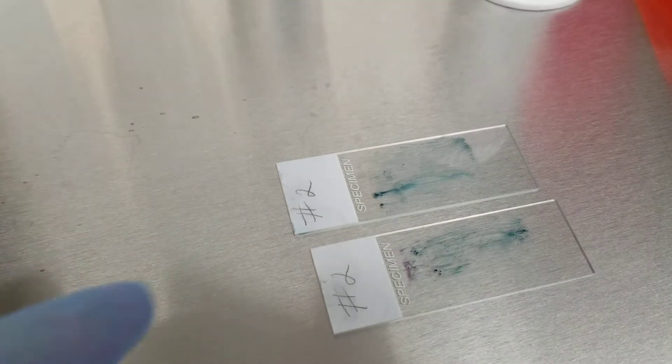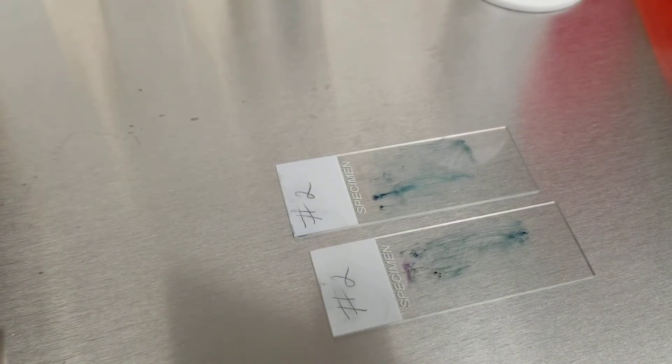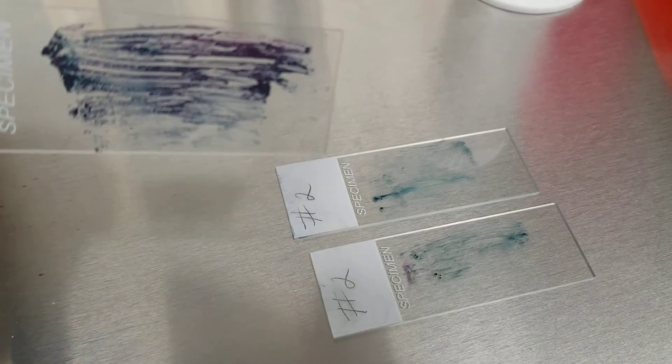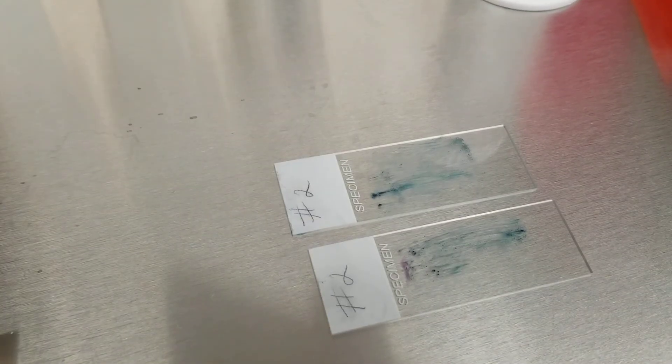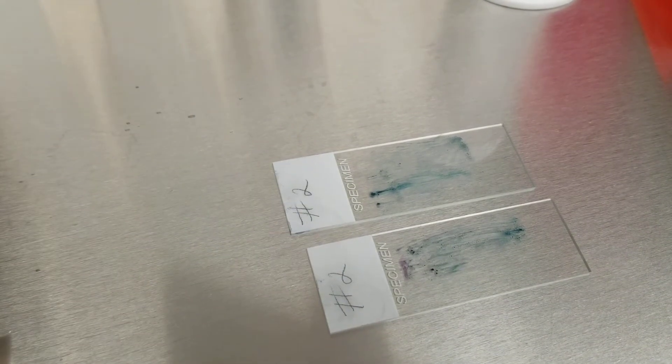So what we have here are two of the slides that we just did. They look really good. The other ones were really thick, too thick honestly, but we'll probably see some good stuff in there. These were nice and thinner. They have a nice color to them. They look amazing.